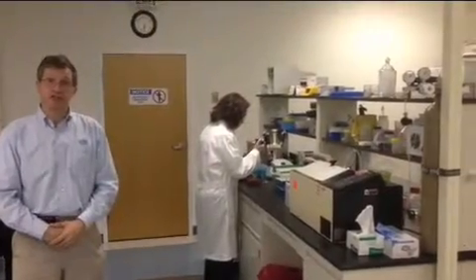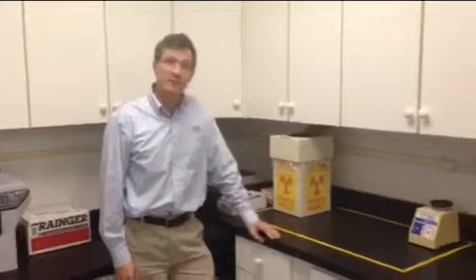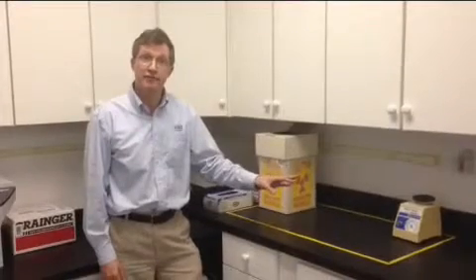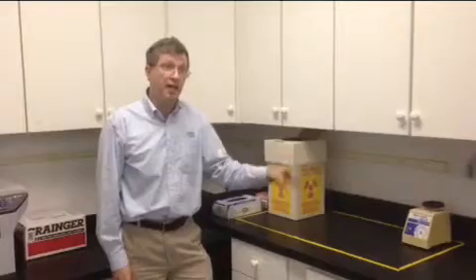So this is where we do our sample preparation and incubations. So we'll deal with our in vivo samples or incubate hepatocytes and microsomes here and generate the samples we use for doing metabolite ID. So this is the area of the lab that we have designated for dealing with radio-labeled samples. We do our sample manipulations, our dilutions and transferring of those radio-labeled materials into HPLC vials, and then we'll go and take them and run them on the mass spectrometer.